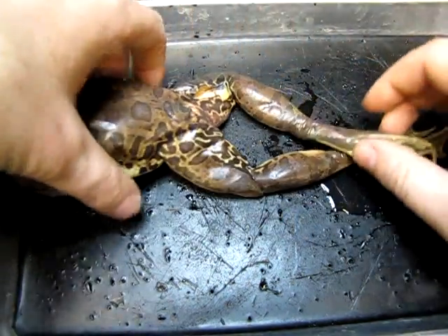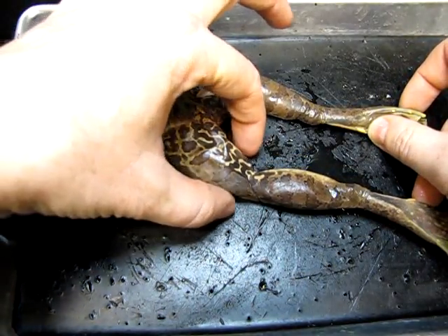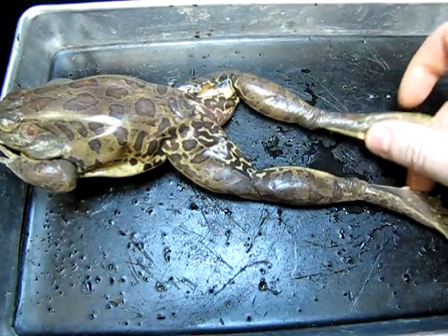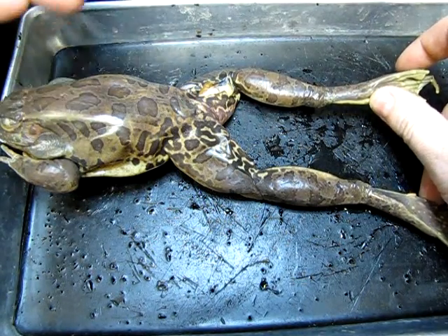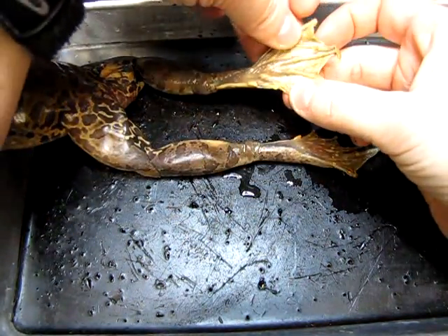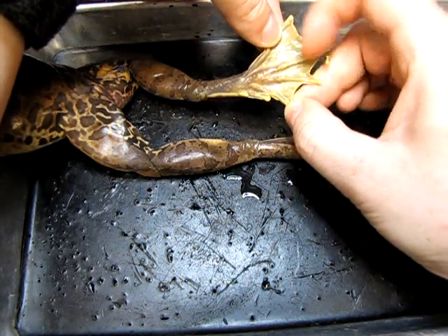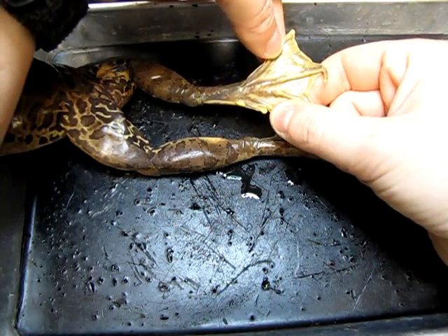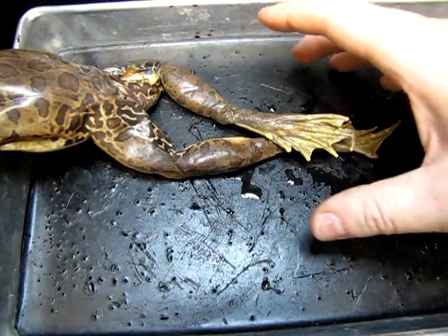The hind legs are clearly much, much longer. You can see the size of the muscles — they're extremely muscular legs, and these are obviously modified as jumping legs. Jumping is a main method of locomotion for these animals. Also, being aquatic or semi-aquatic, you can see that the feet are modified to have webbed toes, with membranous webbing in between. Those act like flippers, which are used to propel the animal in water, so these are swimming legs as well as jumping legs.